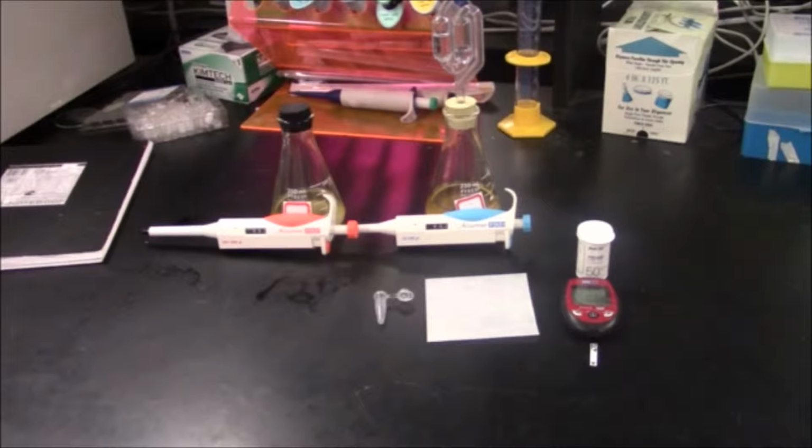Allow the flask to ferment for 2 to 3 days at room temperature on the lab bench. Continue taking samples to test for glucose using the same dilution ratio as in step 9. Samples should be taken several times daily if possible. Record your glucose meter readings and dilution factor, 25:1, in your lab notebook throughout the experiment. You should see the concentration of glucose decrease over time as it is being consumed by the yeast.